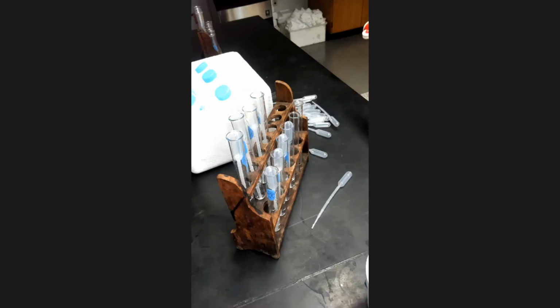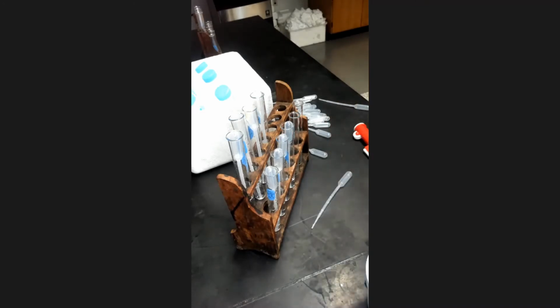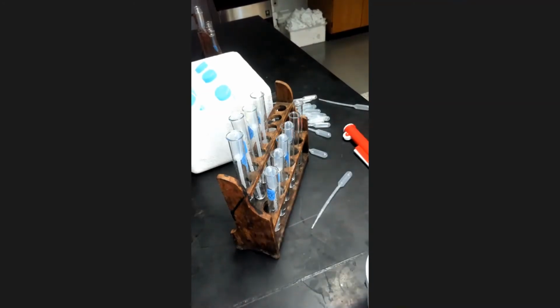Okay, I'm just about at the end of my 10-minute timer, so I'm going to get ready to stop these reactions. To do that, I'm going to be using this stop solution right here, and I will be using this red pipette, red for stop, to dispense the 1.5 milliliters of stop solution into each of these tubes at the same 20-second intervals that I added the enzyme with. So I will start by drawing up the stop solution, and then when the time comes, I will dispense 1.5 milliliters at a time.